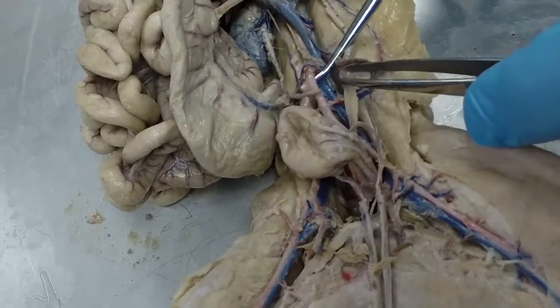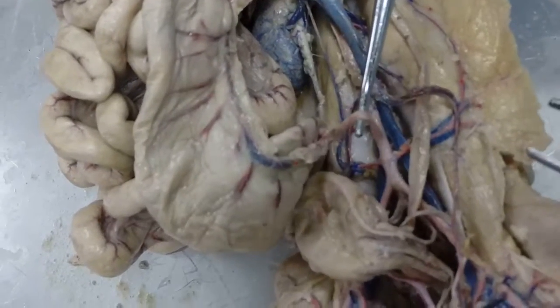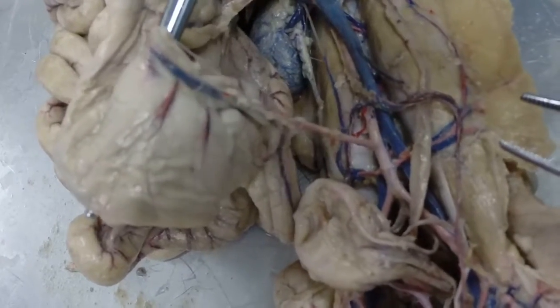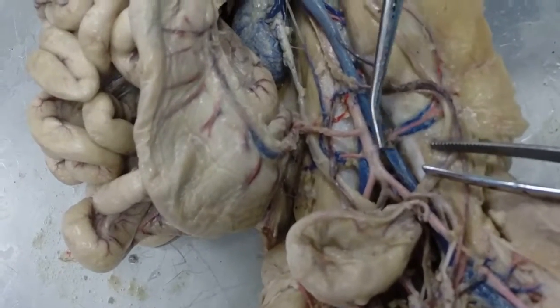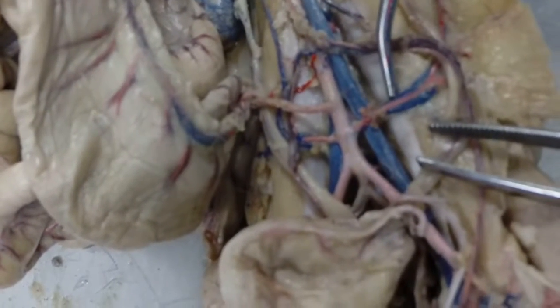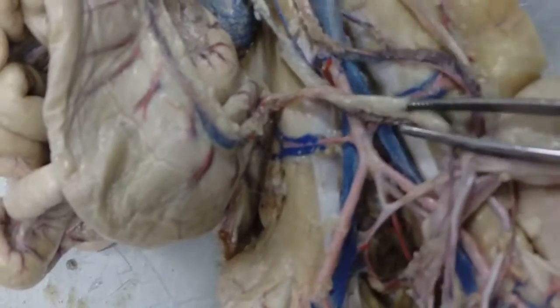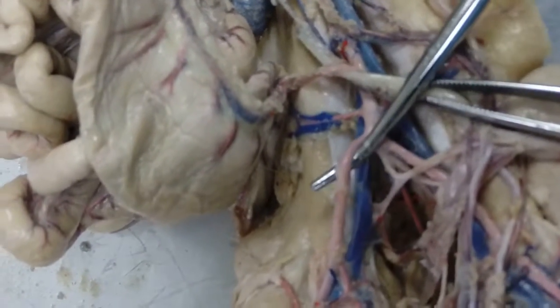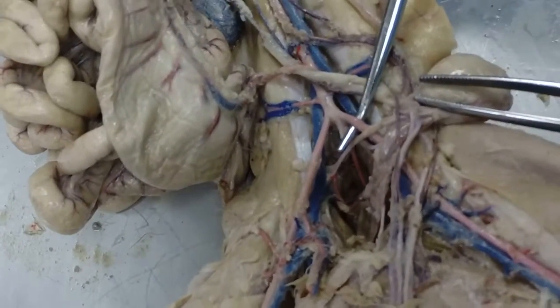Okay, back on the descending abdominal aorta right here. The next branch is this one. This is the posterior mesenteric artery supplying blood to the large intestine right here. Then our next branch, this branch right here, this is the left iliolumbar. So adrenolumbar and then iliolumbar artery. Okay, now our descending abdominal aorta is going to branch twice. So the first branch, these are called the external iliac artery. So this would be a right external iliac artery, left external iliac artery.